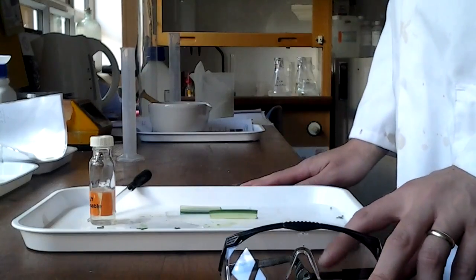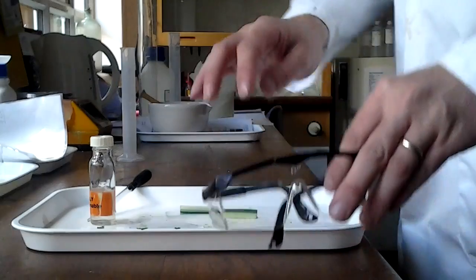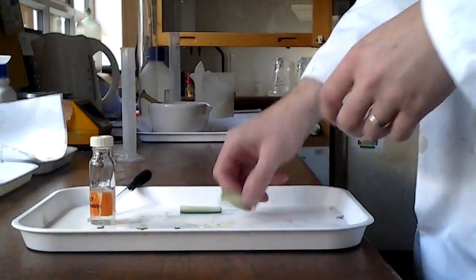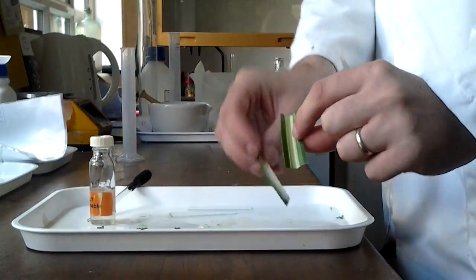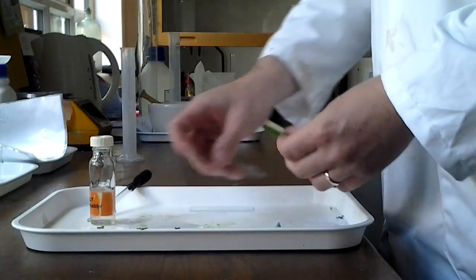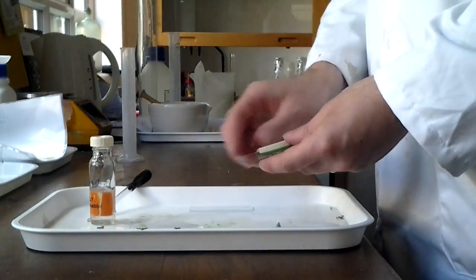So the first thing we're going to do is extract some pigments from the leaves. This is going to involve a solvent, so the goggles will go on. You'll be given some plant leaves, typically spider plant leaves that look like this, and they have veins that run in this direction. What we have to do to start with is break open those cells and get the pigments out.